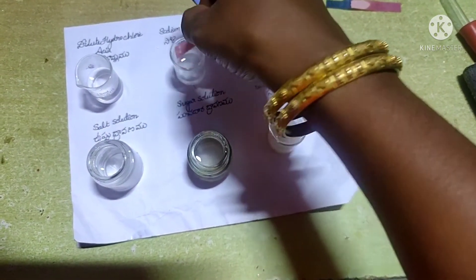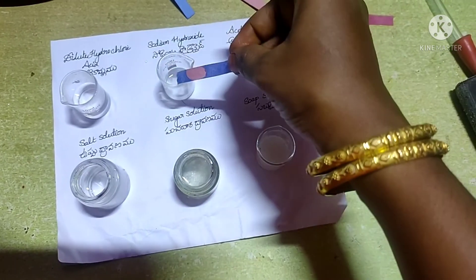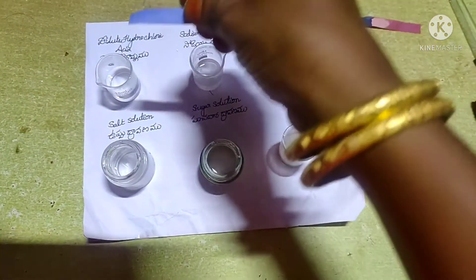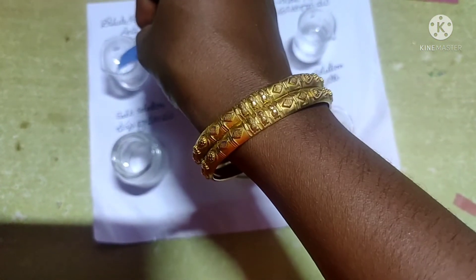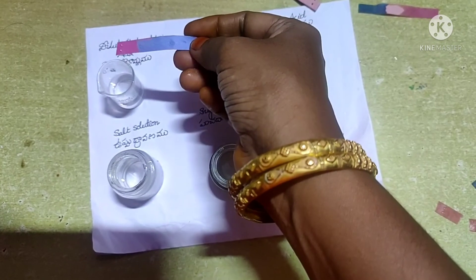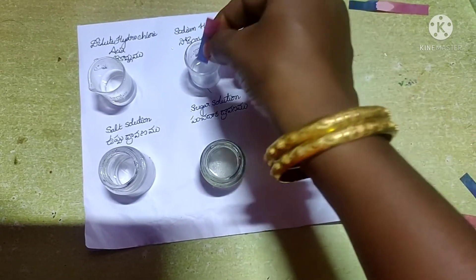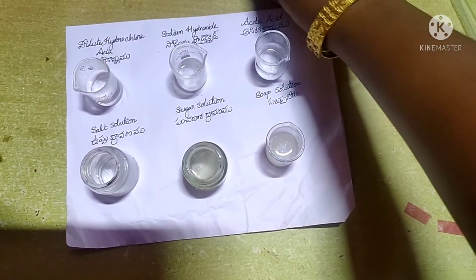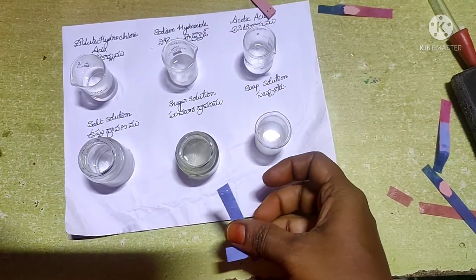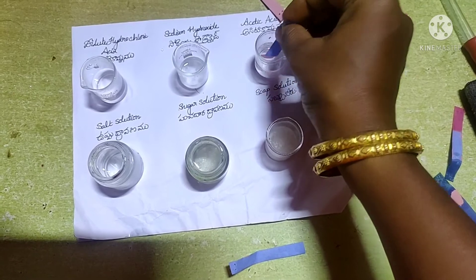Next, take blue litmus paper and observe the color changes. Dip blue litmus paper into dilute hydrochloric acid — it turns red. Dip blue litmus paper into acetic acid solution — it also turns red. Whenever blue litmus paper turns red, it indicates the presence of acids.